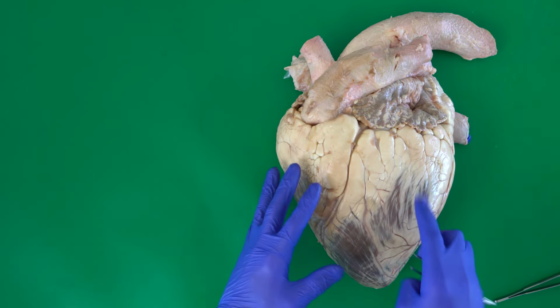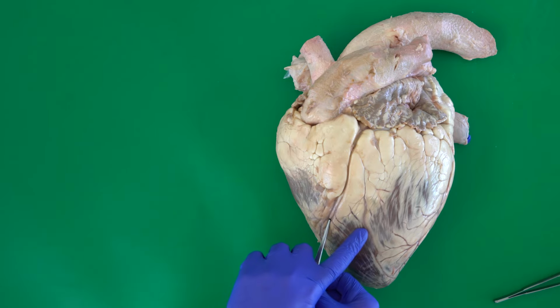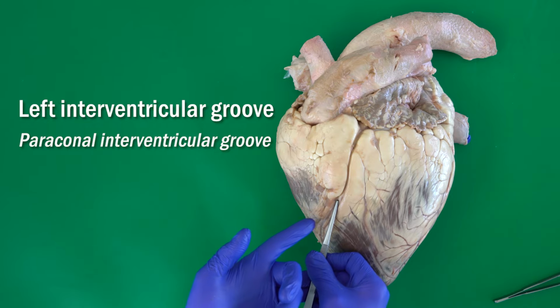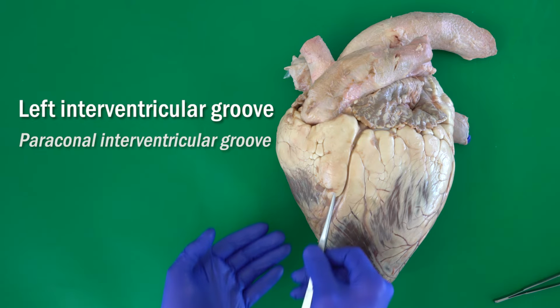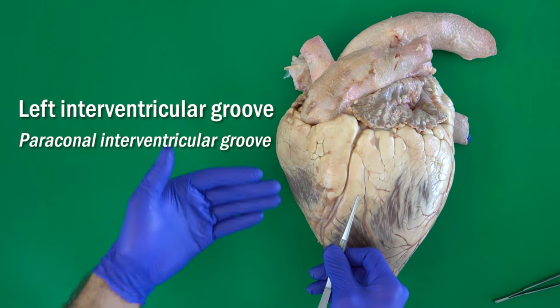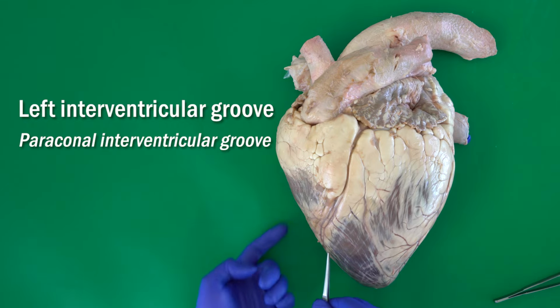If you look carefully, we will find a big groove at the level between the right and the left ventricle. This groove, because of its location, is called the interventricular groove. On the other side, we have another groove located at the same level. It has the same name, interventricular groove, and that's why we name this one the left interventricular groove. The other one is the right interventricular groove.